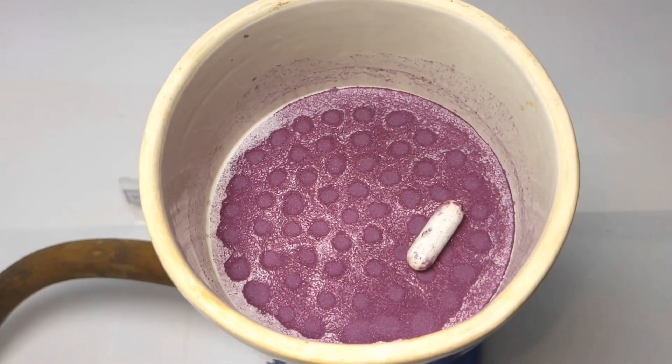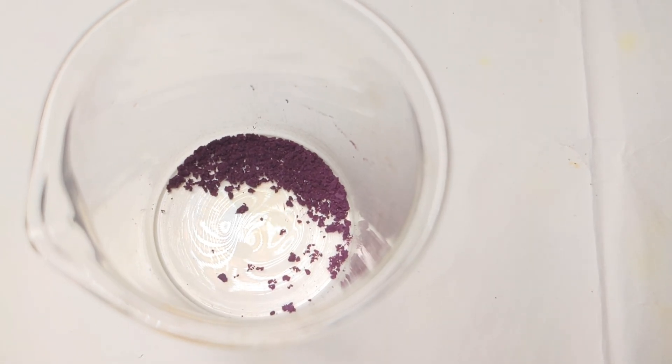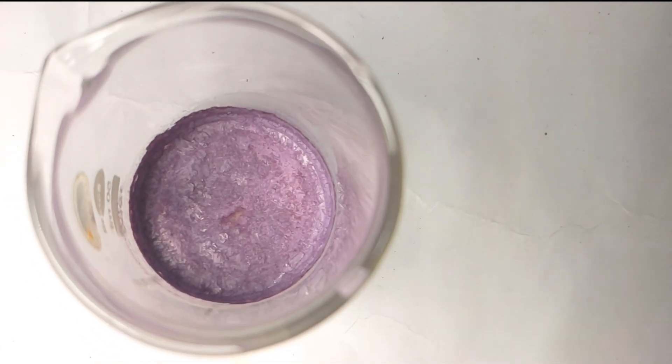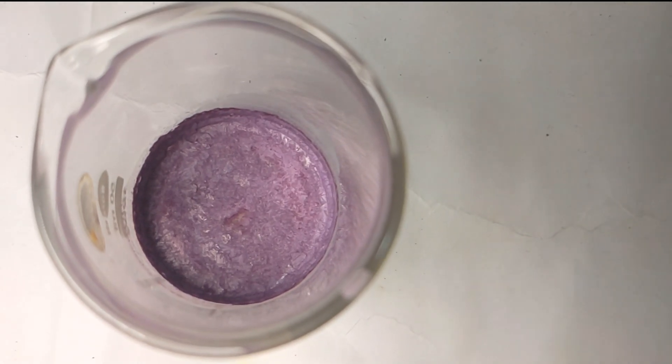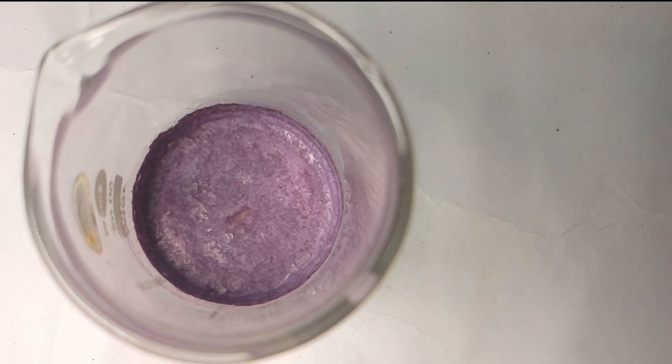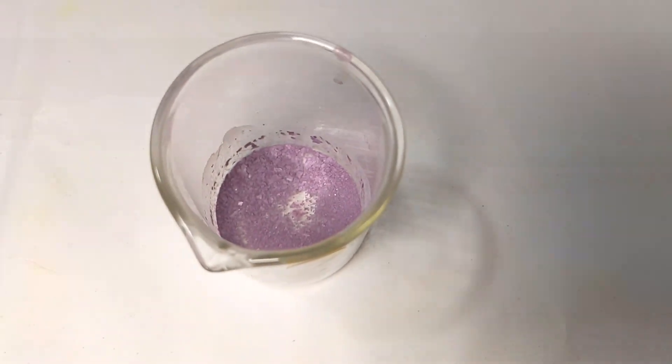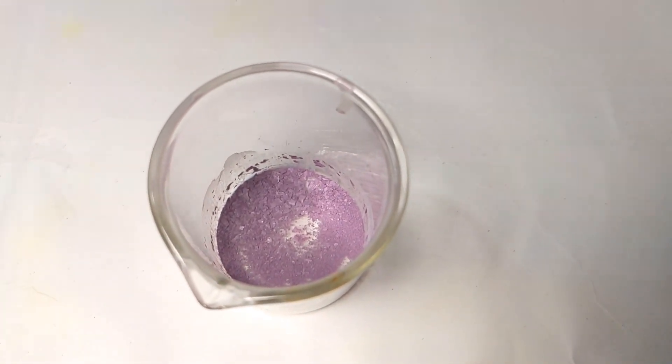I tried to recrystallize some from dichloromethane but the color became a little dull. Finally, we have the product: Chromium Acetylacetonate. So that was a simple procedure.